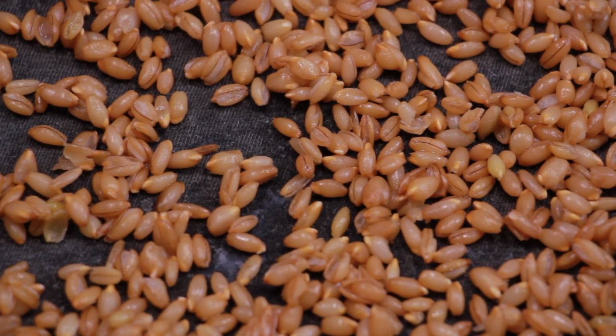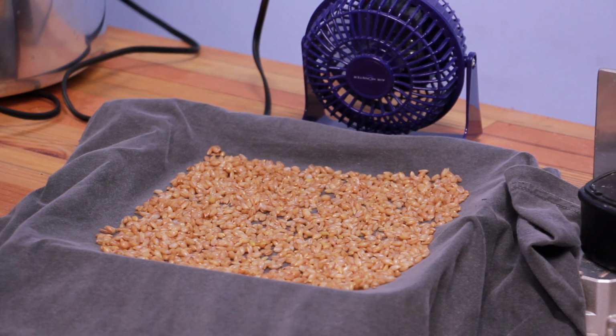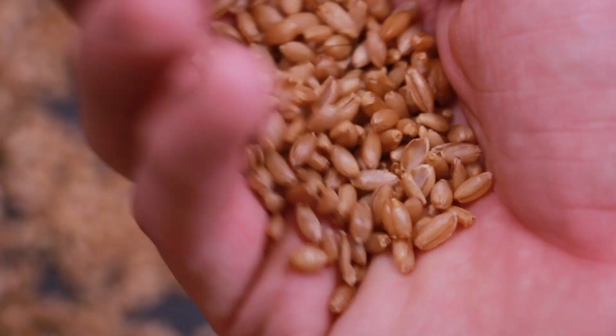Eventually, I put it under a fan to help dry it even faster. So after about 2 hours of air drying, the grain looks nice and ready to go for inoculation.